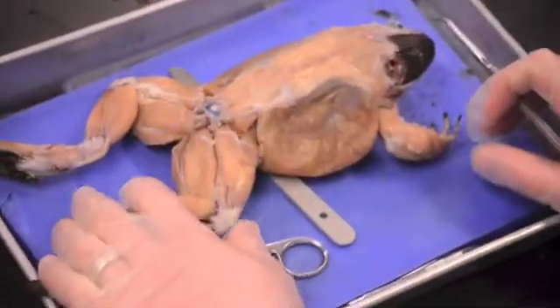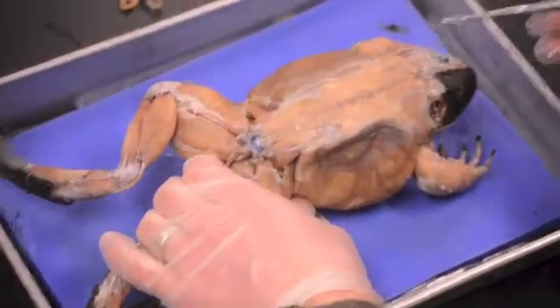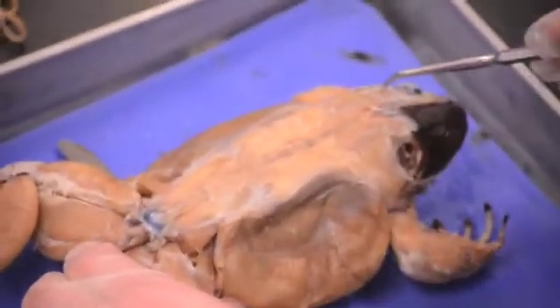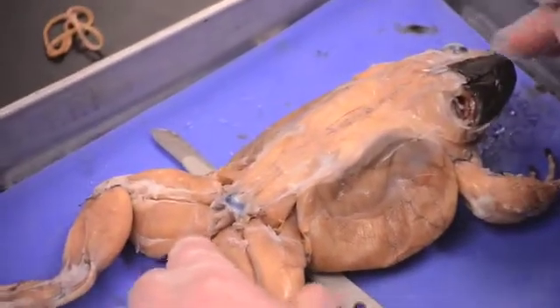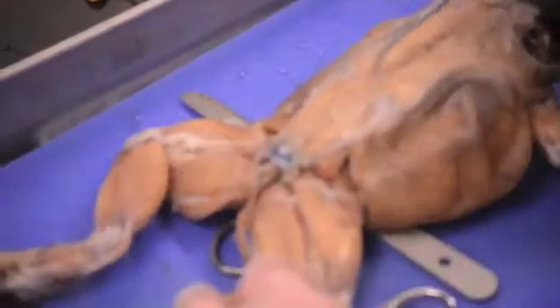We're going to begin with the external features. The first external feature is called the tympanum — these large structures that look like ears. Really, that's what the tympanum is: a simple, primitive ear that these frogs have. You also have the eyes, and the external nares, which are just the openings for the nose. There's also a line going down the back of the frog called the medial line.